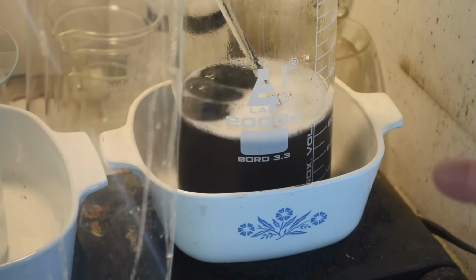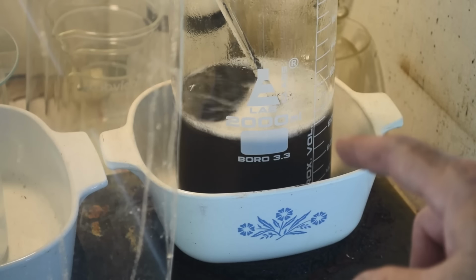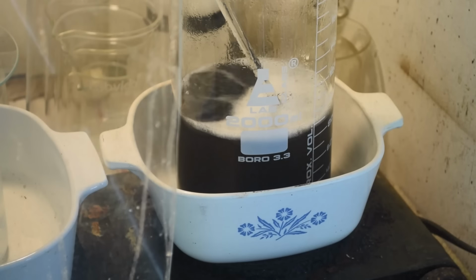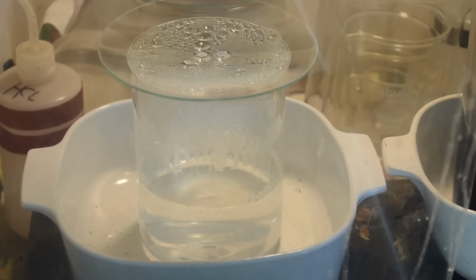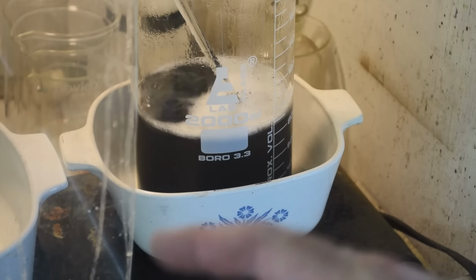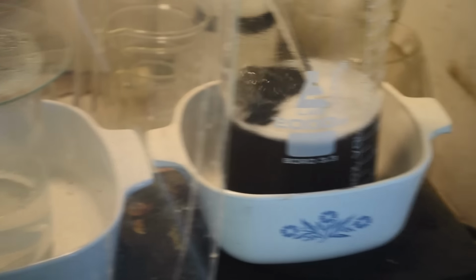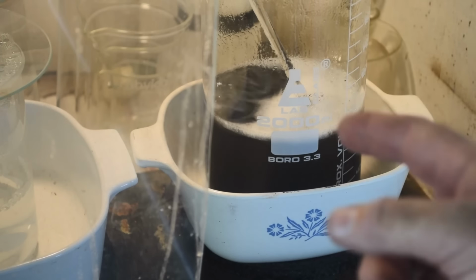Alright, this stuff has been boiling for 25 or 30 minutes. Now, it may not look like it at first, but the liquid has cleared a lot. I put another splash of the ammonium formate liquid in there, and I think that helped some too. But I want to save the rest of it for the other half of the material I need to process. But yeah, this has actually cleared a lot.